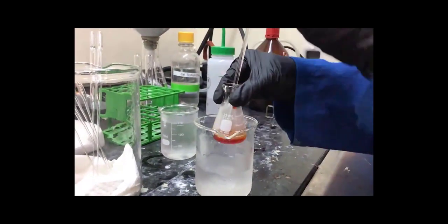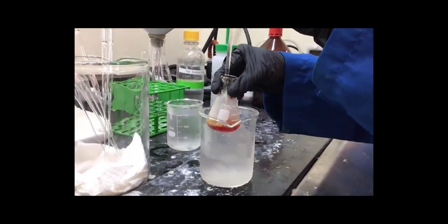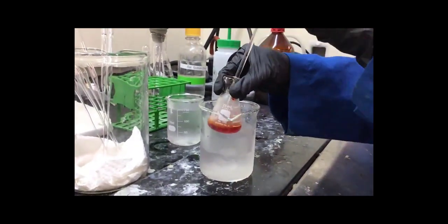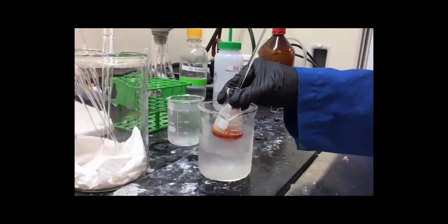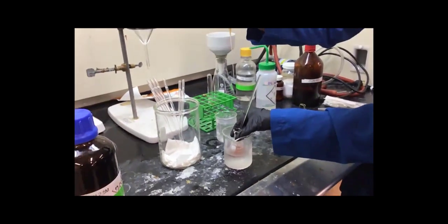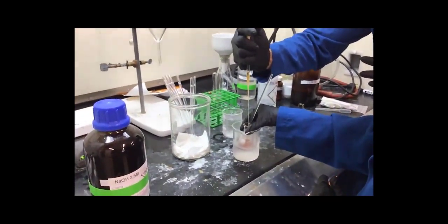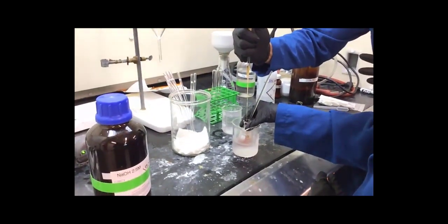All right, and they've already mixed the two together. They've already started mixing together, but they are mixing them together while stirring occasionally with a glass stir rod. And so you can see it went from kind of a yellow orangish color to now it's more of a reddish orange color. So we've already seen a reaction taking place.